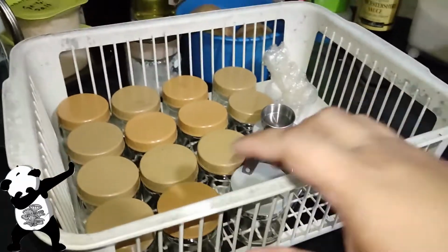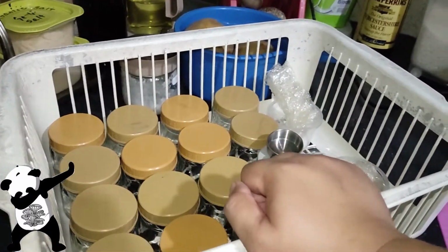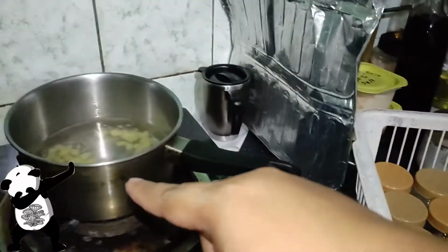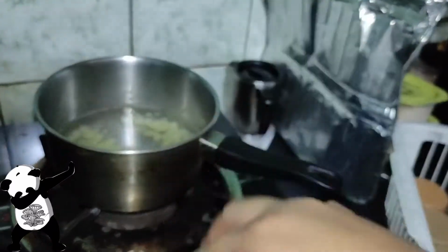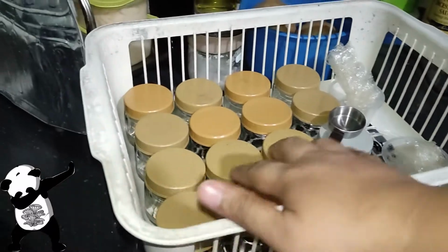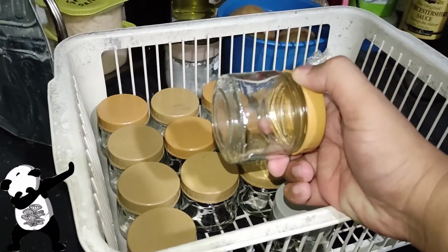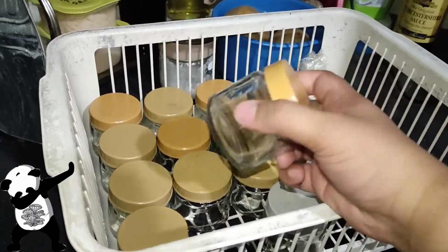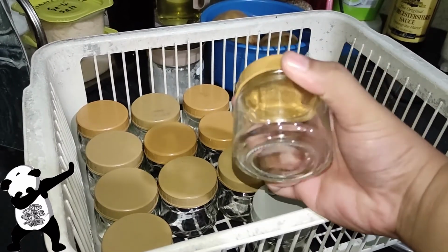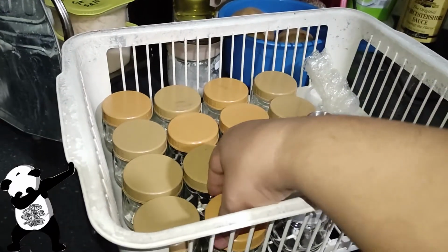Okay, so these are our clean plates, the ones that were soaked in vinegar. I prepared some agar, dextrose, and our potato boiled for 15 minutes. Hopefully these plates, usually I'm not gonna use it for 4 days, but I'm gonna extend it up until 9 days because there are recent issues of molds coming out on the 9th day. So let's see what's gonna happen.